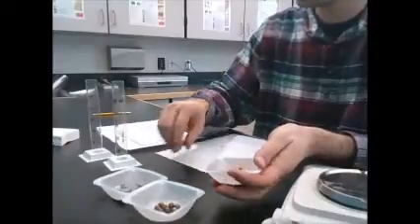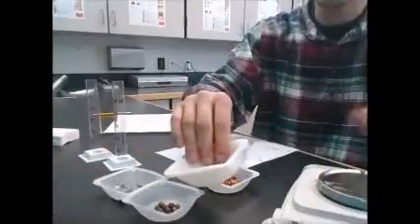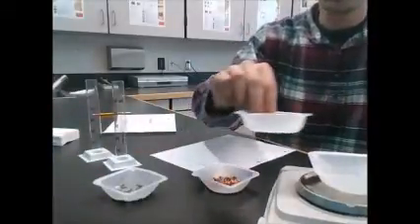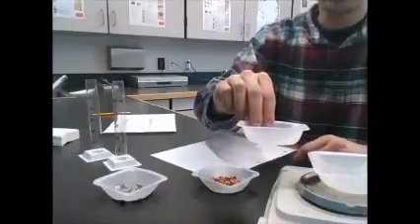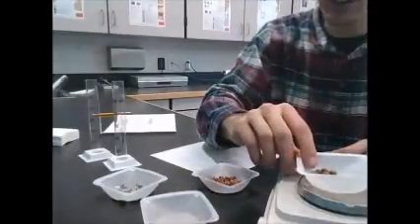Each one, you could find what its mass is. So we've got some extra little trays. We could put them on the scale, and we want to make sure it's zeroed first. And we could find what the mass of this sample is, right? The other part we need to know for density is to find its volume.